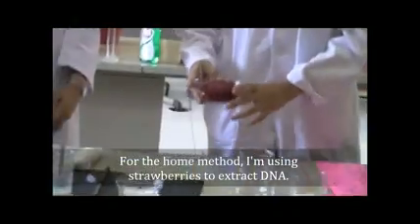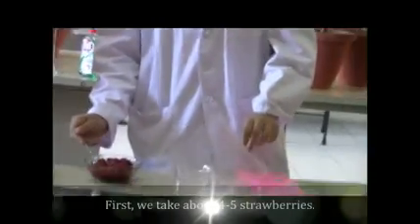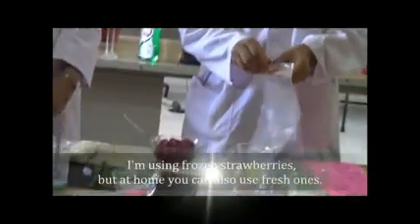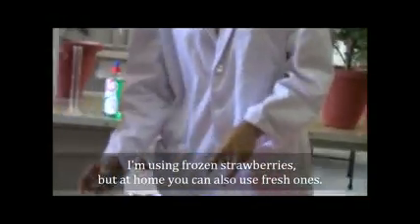For the home method, I am using strawberries to extract DNA. First, we take about 4 or 5 strawberries. I am using frozen strawberries, but at home you can also use fresh strawberries.